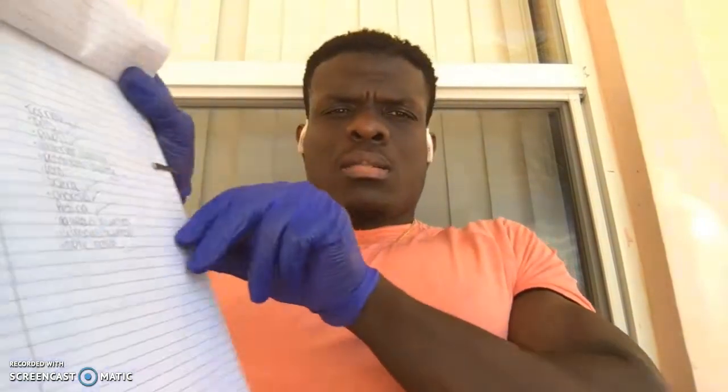So today we'll be going over the different ocular structures of the cow's eye. We did the cow eye dissection, and we're going to be going over the different components of the ocular structures. The notes that I have are just a checklist of the different things I'm supposed to be going over.